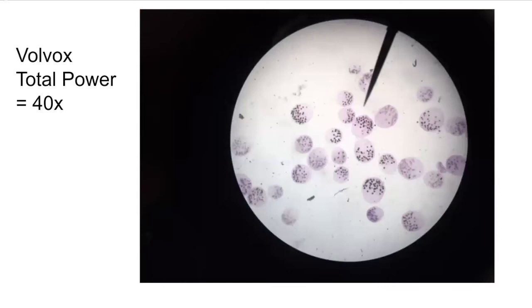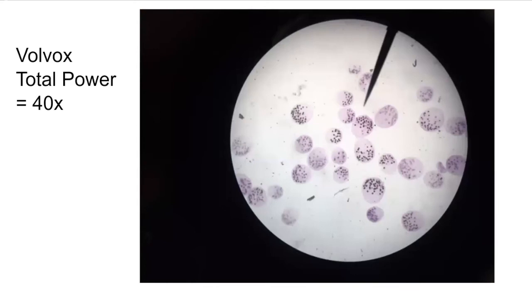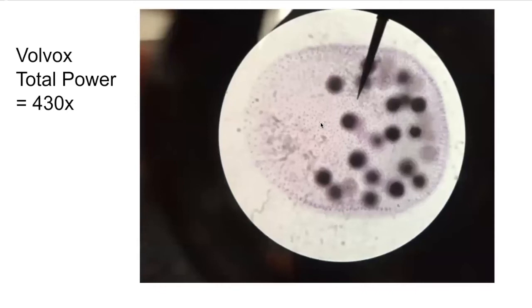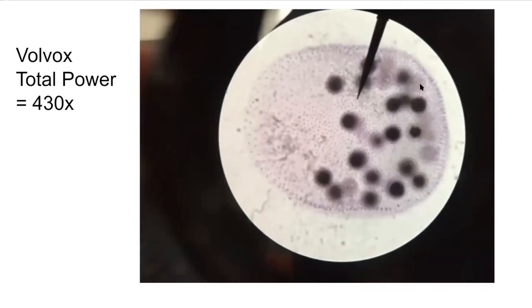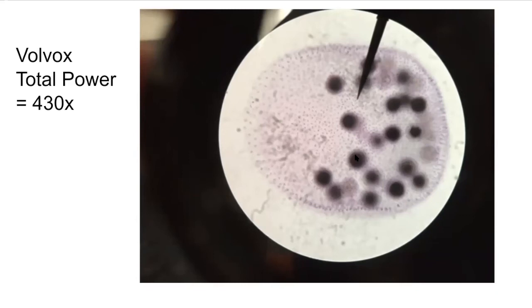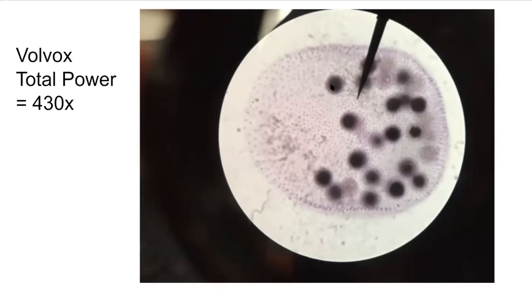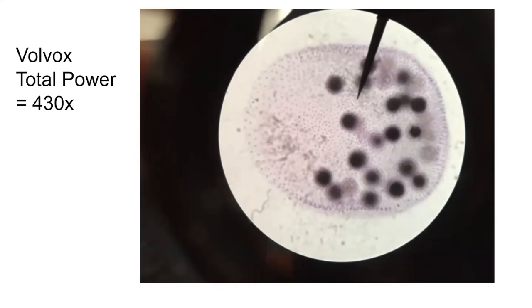We also looked at Volvox, our only multicellular protist. On low power, you can see its round colony shape. As we increase power, you can see more and more detail. Each one of these little purple dots is an individual cell, and they all work together to make the colony. The dark spots inside are not nuclei — they are more colonies of Volvox that are going to mature inside of the organism and then break free to start their own colony.